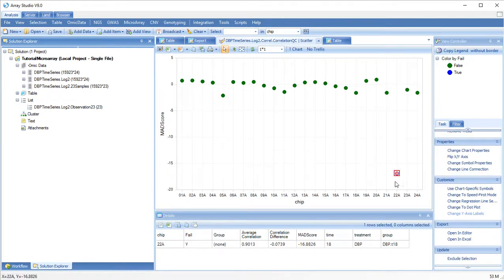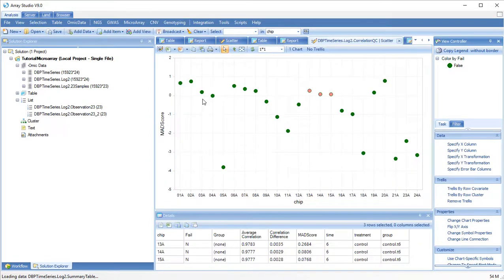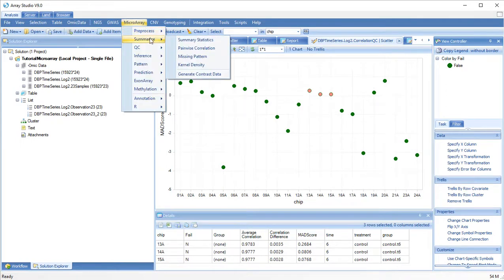You can directly exclude this selection under the View controller. Then, a new analysis will be run on the remaining 23 samples. You can also directly visualize the correlation between samples under Microarray, Summarize, Pairwise Correlation.